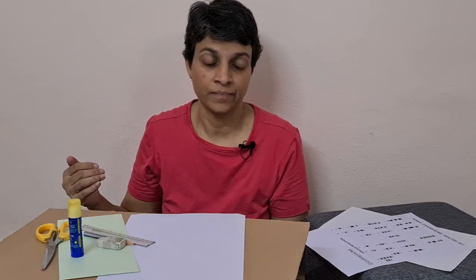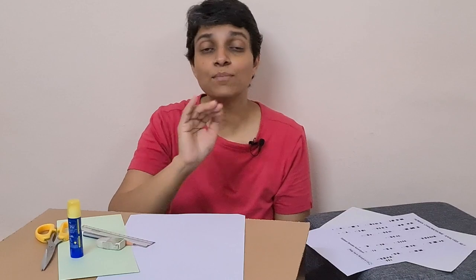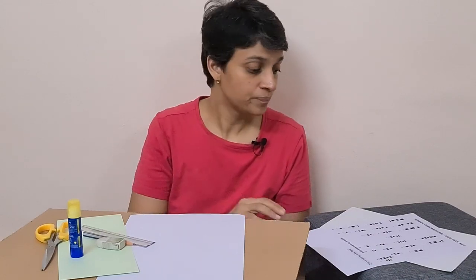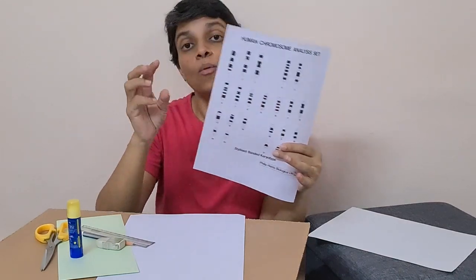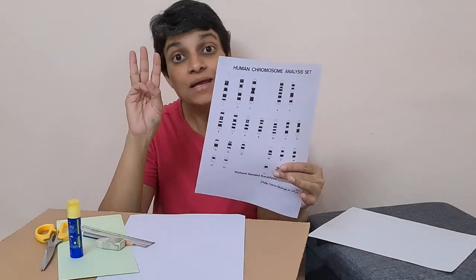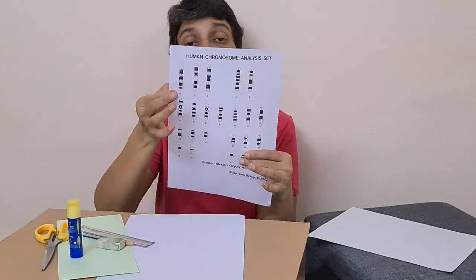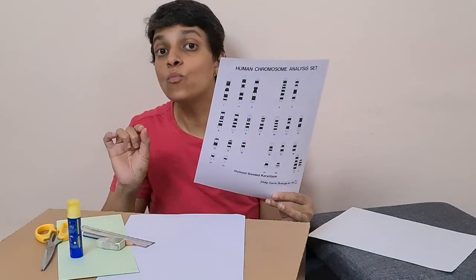The seven groups are A, B, C, D, E, F, and G. In karyotyping, we arrange the chromosomes as homologous pairs. There are six chromosomes in group A — two of pair 1, a pair of second chromosomes, and a pair of third chromosomes.